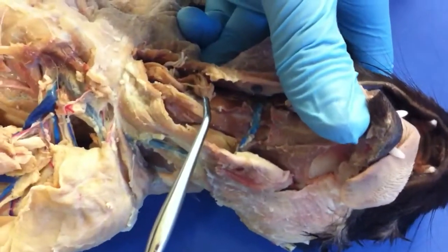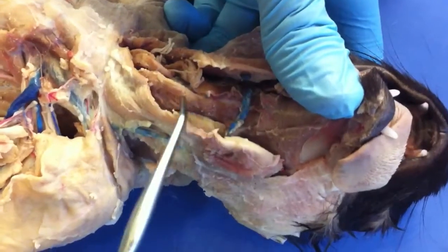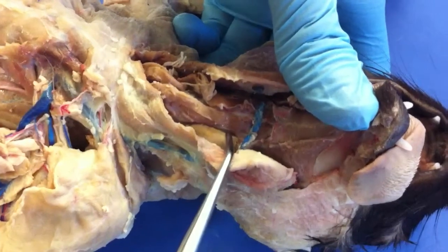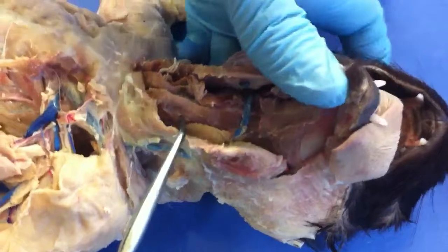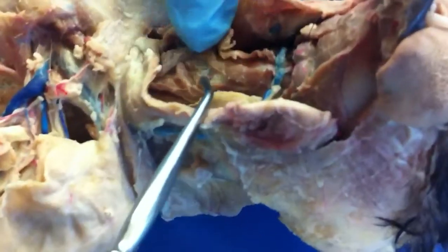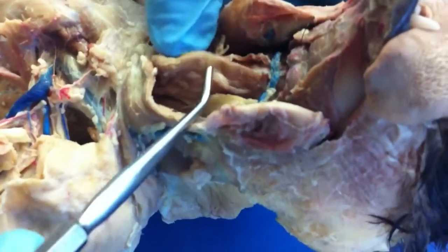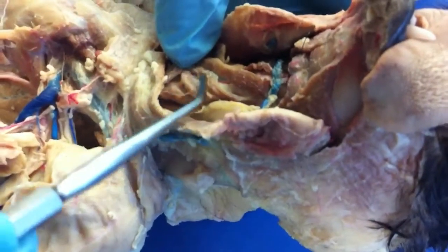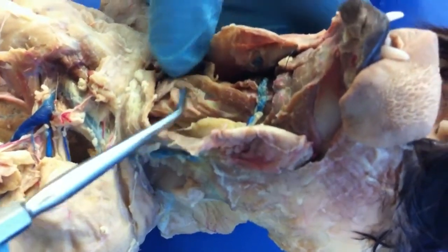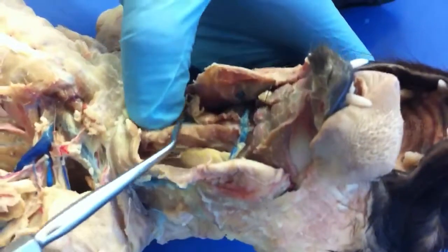That is the sternohyoid. Hyoid is in the middle, so sternohyoid is middle. And then just lateral to that is the sternothyroid — so thyroid's off to the side, and hyoid is in the middle.